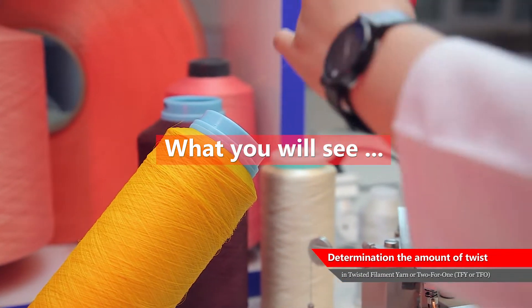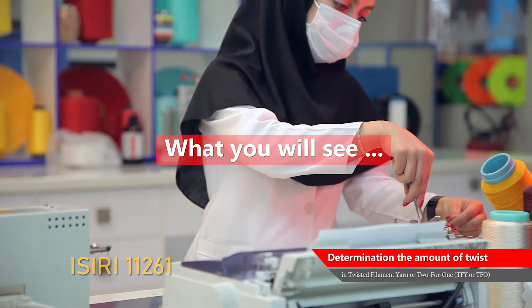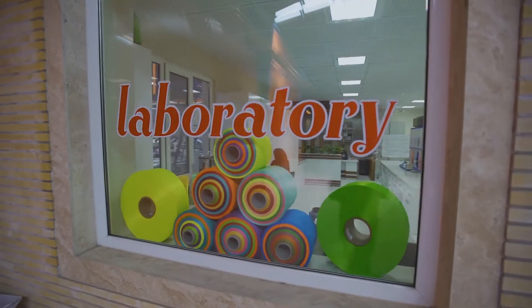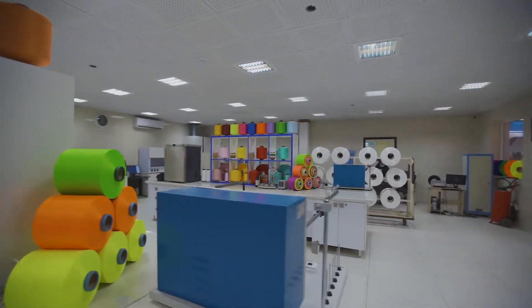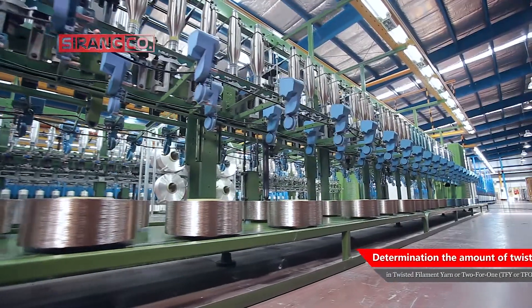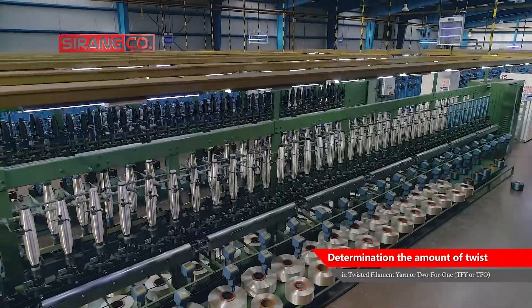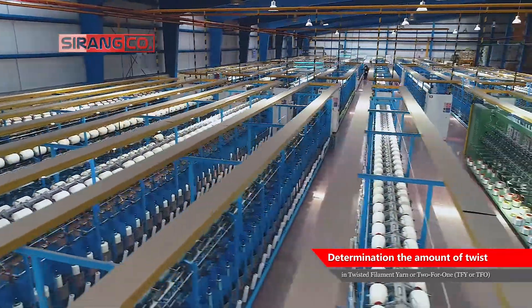To determine the yarn twist, it is first necessary to determine the yarn twist direction according to the National Standard of Iran No. 11261 or ISO 2:1973. This video covers the determination of the amount of twist in twisted filament yarn or 2-for-1 twist. Twist is the spiral arrangement of fibers around the axis of the yarn in terms of the nominal length of the gauge before opening, and is preferably expressed in terms of the number of twists per meter.